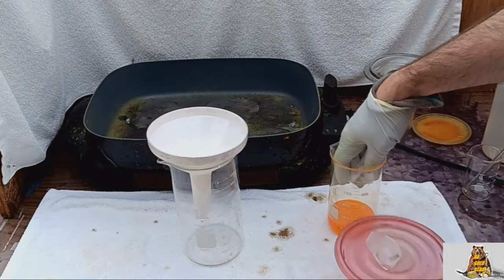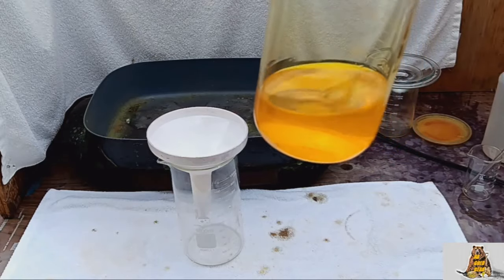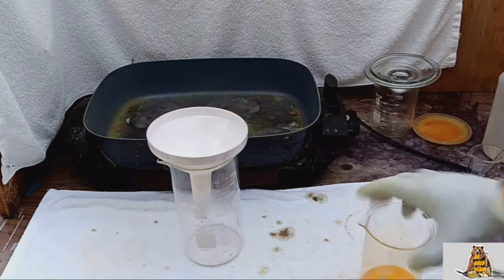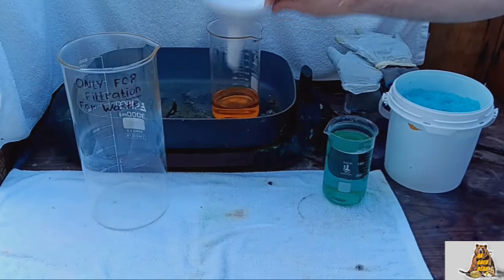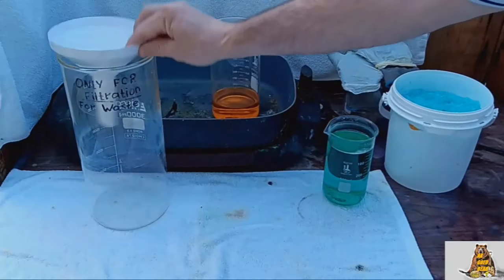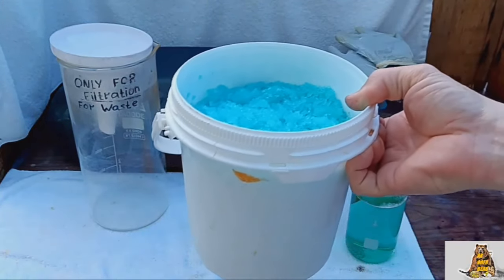Good enough. The solution is crystal clear — no sediments, no chlorides. Beautiful. Filtration. The filter is pretty clean, that's good. I will precipitate the gold with iron sulfate again. I'm always making iron sulfate myself — if you want to know how, I'll leave a link down below.